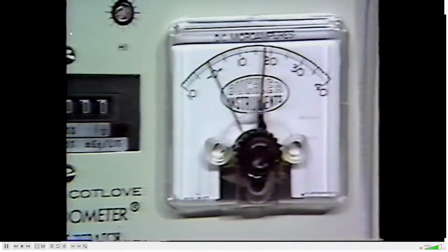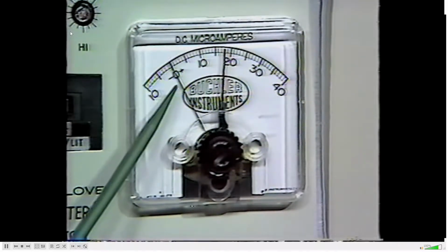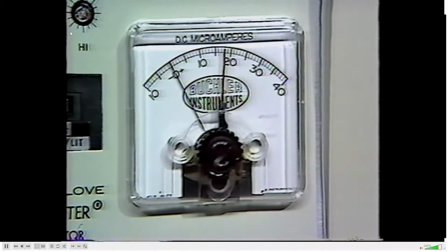A direct current ammeter records the amperage detected by the indicator electrodes in the titrant solution. Surging current at the endpoint causes the black indicator pointer to reach the adjustable red pointer. At the endpoint, a distinct click is heard as the relay switch is activated to shut down the digital recorder and generator electrode circuitry.